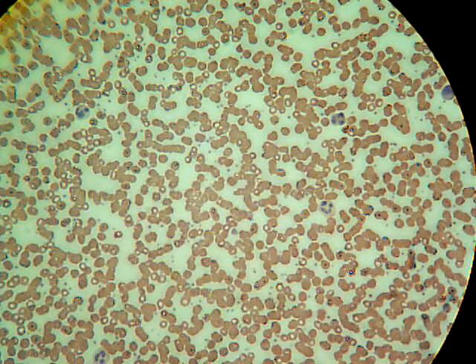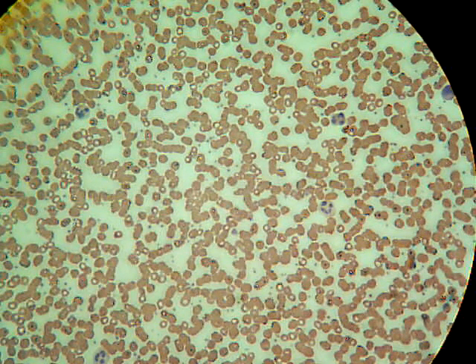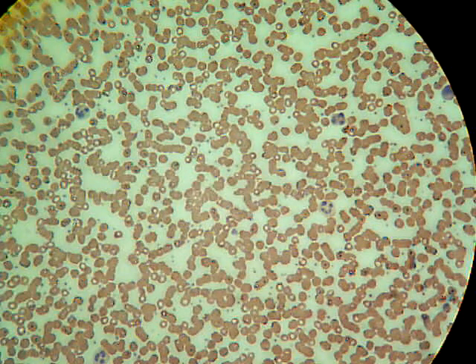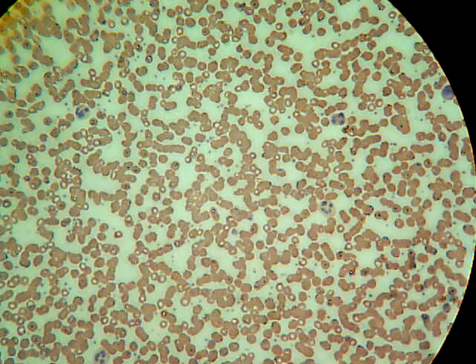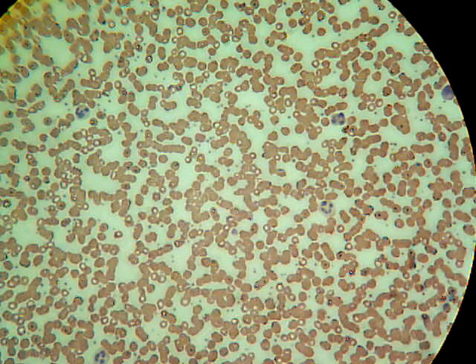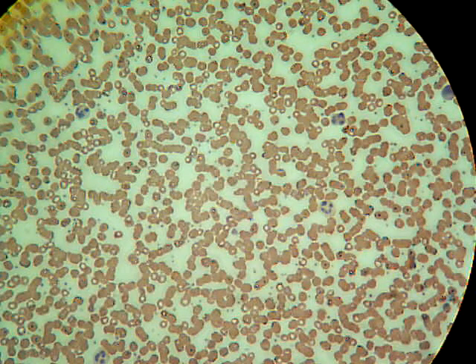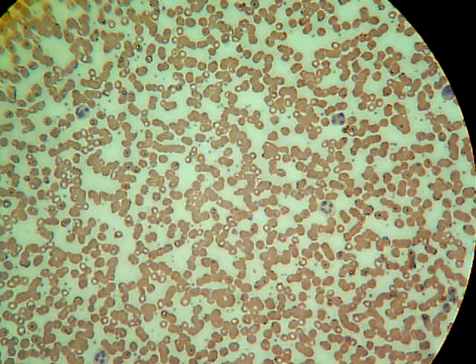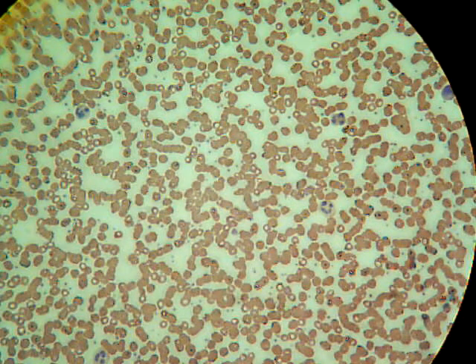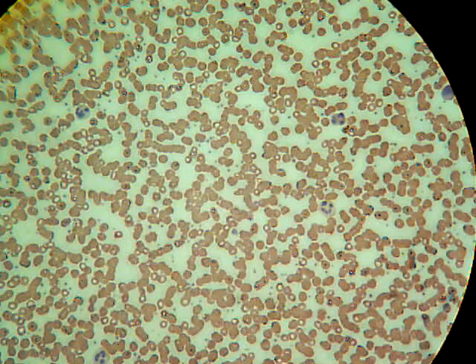In another lab, we will be trying to identify the different types of white blood cells based on the shape of their nucleus, their size, their abundancy. But right now, all we're doing is just identifying this as a connective tissue, this blood.